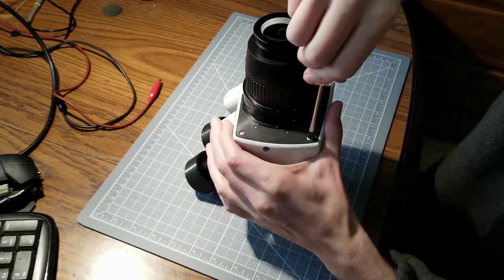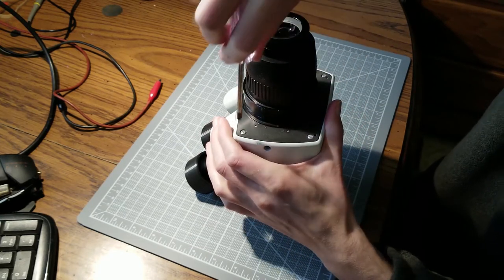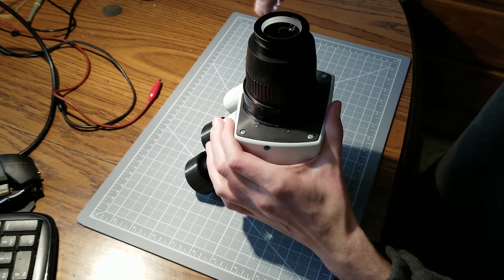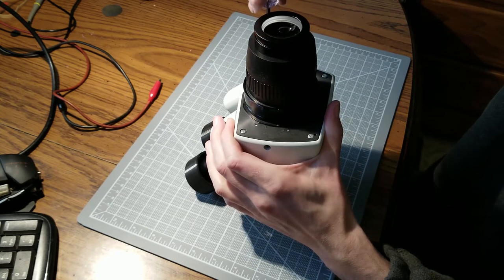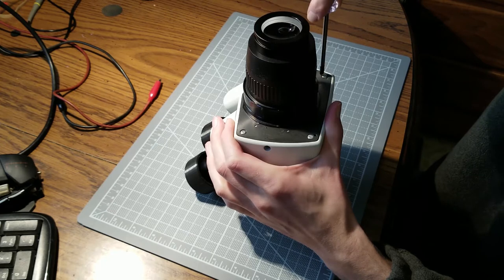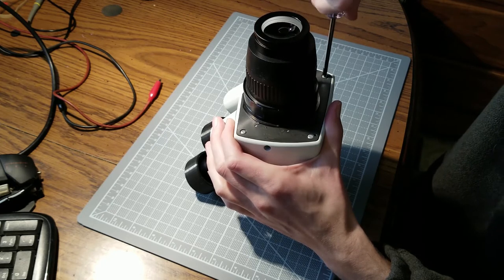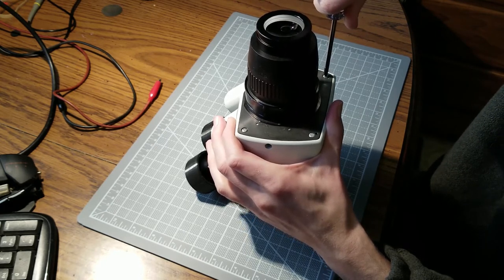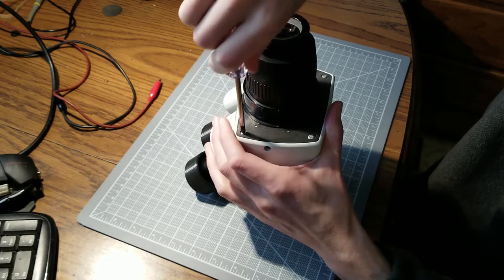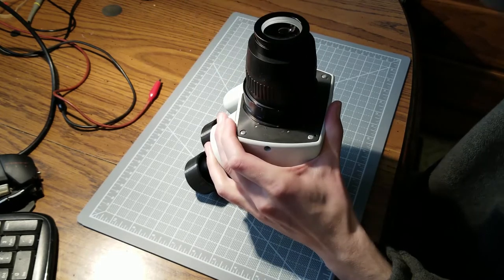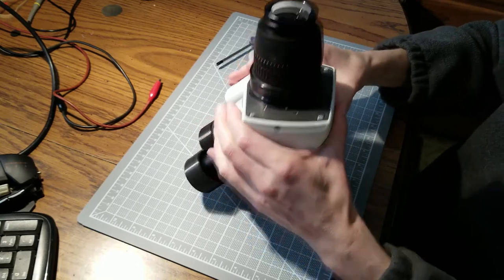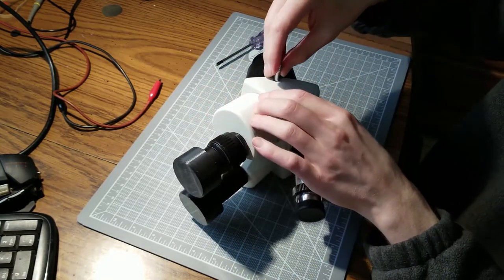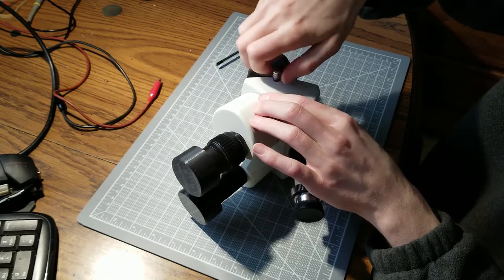I find trying to work on things under the microscope and either film or take photographs of them is pretty difficult if you're working with one eye only. So it would have been nice to have binocular vision for yourself and also be able to record, but that is not possible with this model.